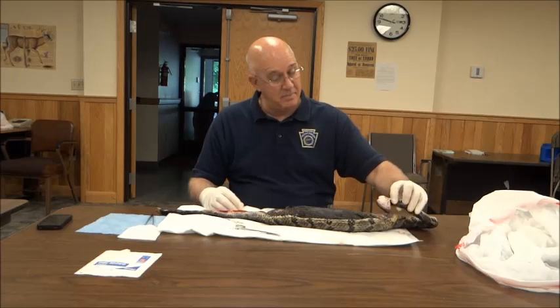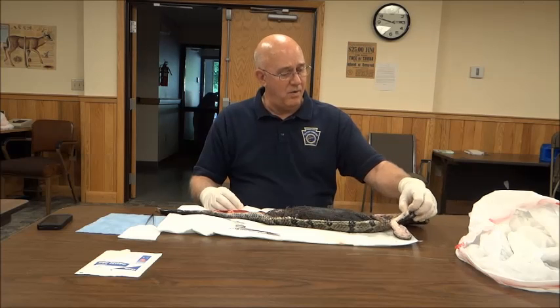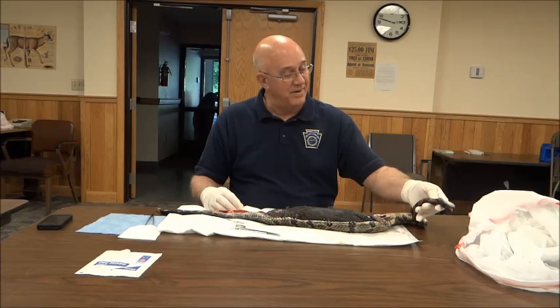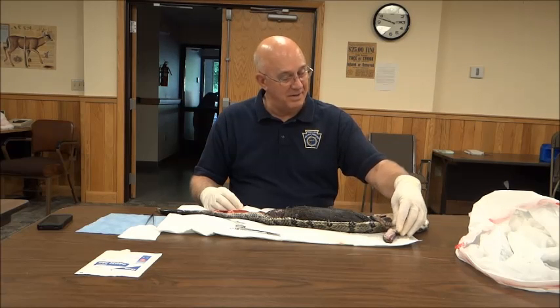It's a big snake. Look at the size of his mouth. But you wonder how he goes through the neck area. I know it stretches a lot up there. You can see how far the scales come apart — that's amazing.